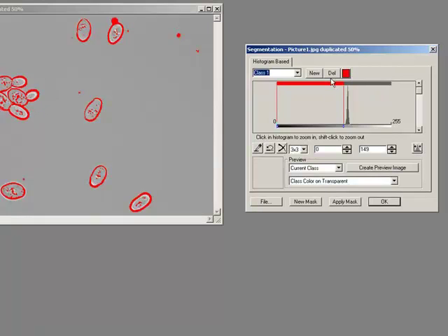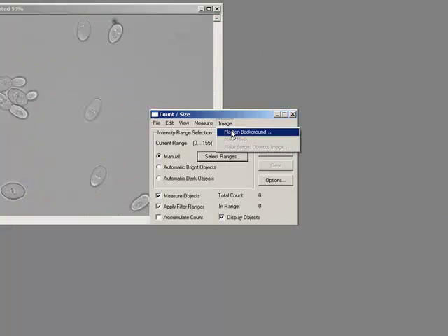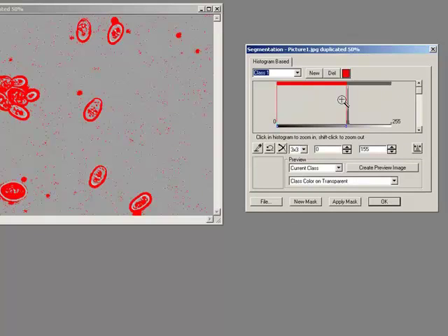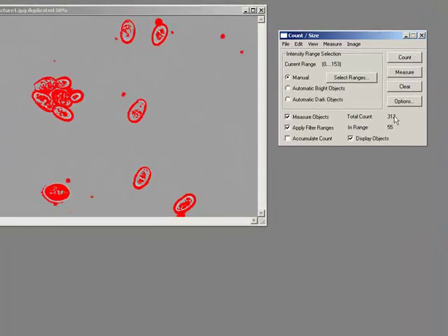So what I can actually do is I could say, well, how can I process this image correctly? One other problem I have is a background issue here. So let's start off here and let's do maybe a flattened background, bright, go. Okay, so that's nice. Now I can go here and say, well, they're the objects I want. Ignore all the other ones, don't worry about those for the moment. And if I count, that's pretty good.